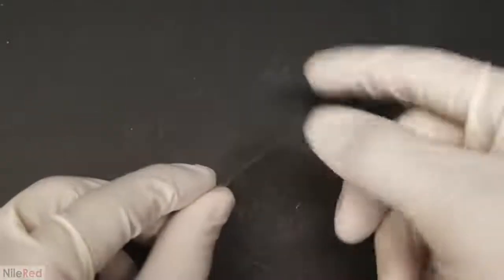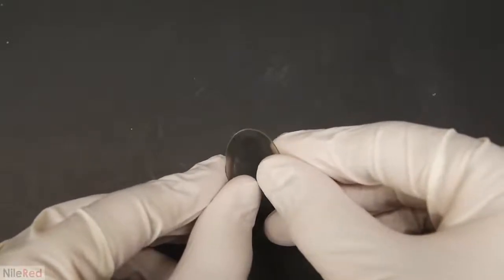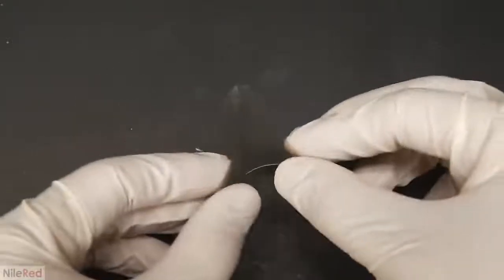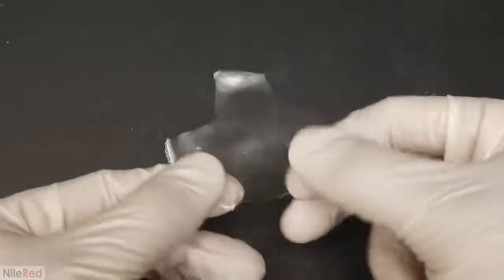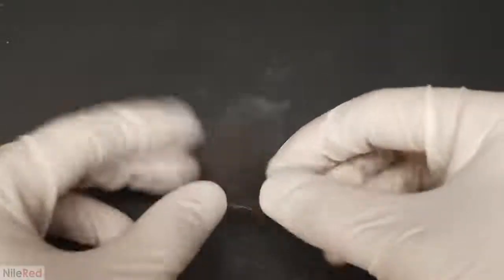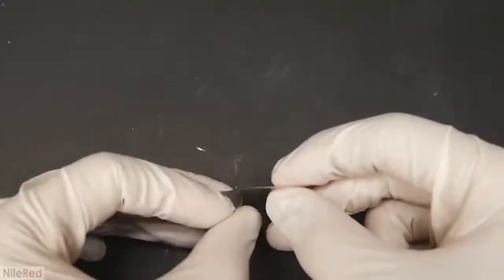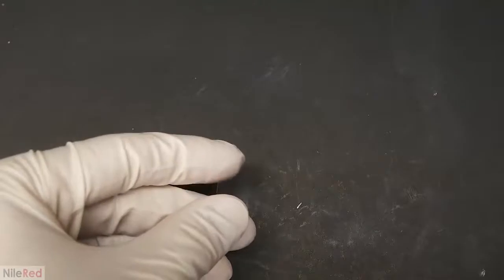Even after everything was dissolved in the acetone, it was still a cloudy mixture because of a bunch of impurities. As the film forms, the impurities get incorporated into it, and I'm sure they impact the structure and quality of it in some way. I didn't want to completely break it into pieces like the other one, but I did snap off a small portion of it.